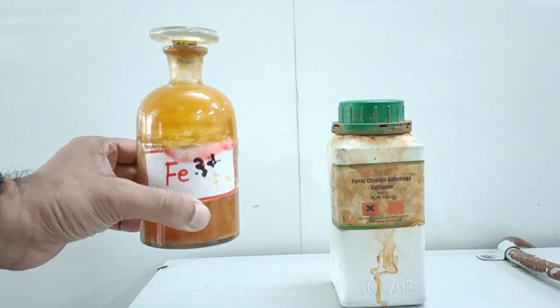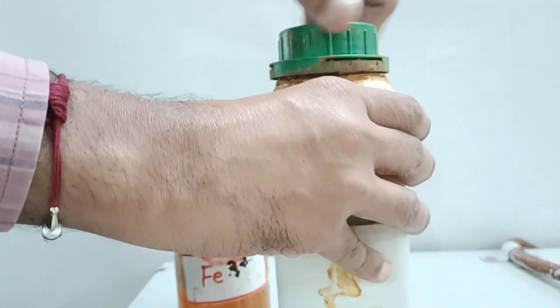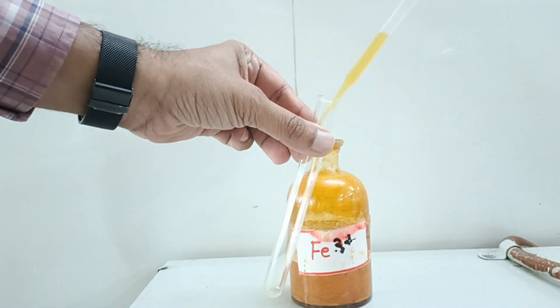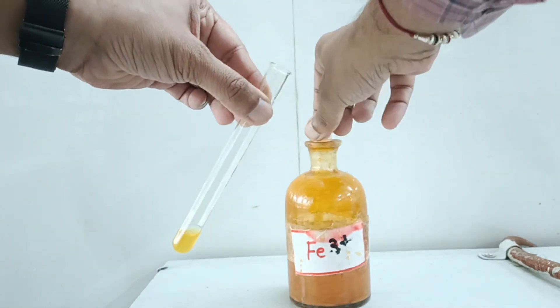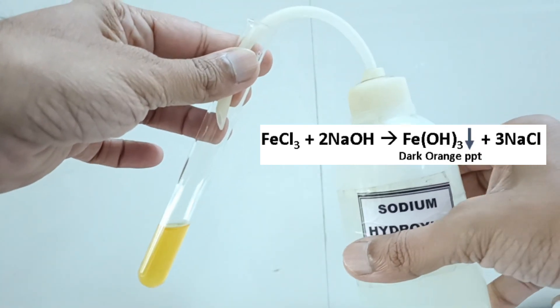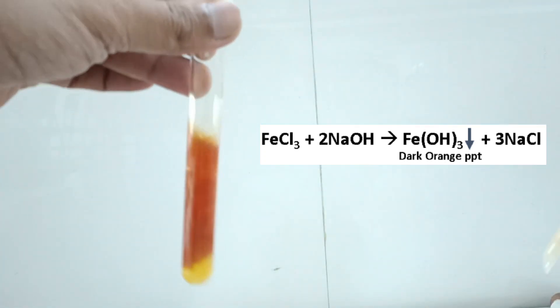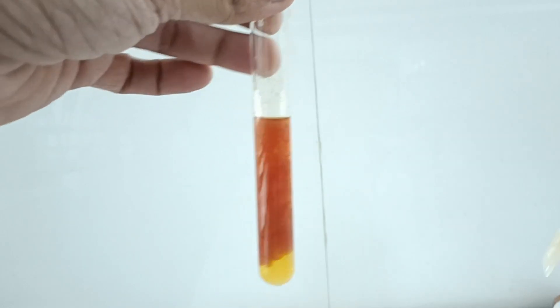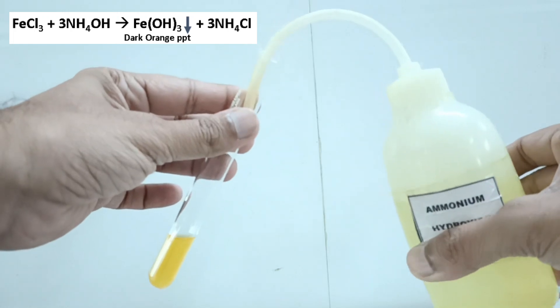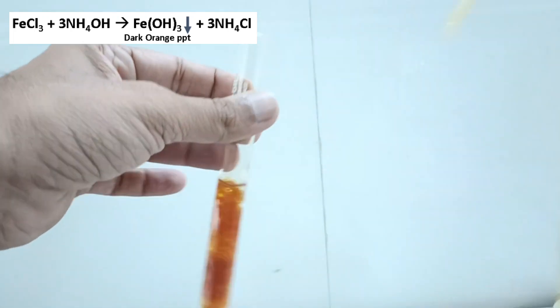Here I have orange colored FeCl₃, or ferric chloride salt. Adding about 1 ml of sodium hydroxide to its solution, we see reddish-brown precipitates are formed. On adding about 1 ml of ammonium hydroxide, similar reddish-brown precipitates are formed.